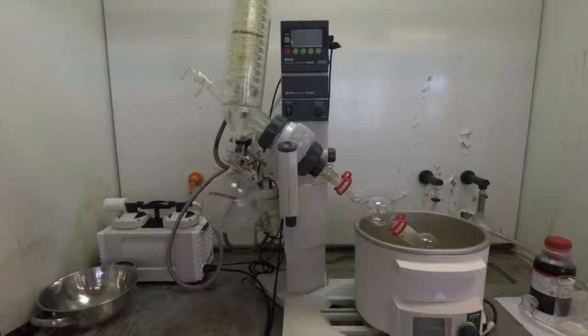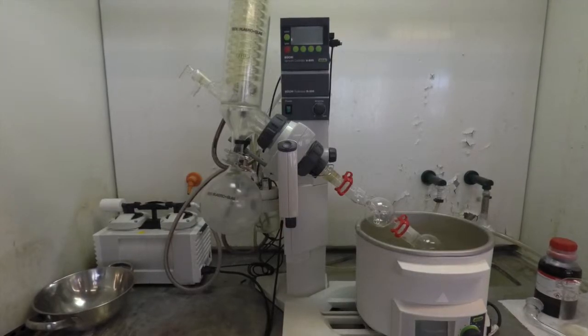The Rotavapor is used to evaporate solvent at low temperature. This is useful to isolate the product without causing potential heat damage.